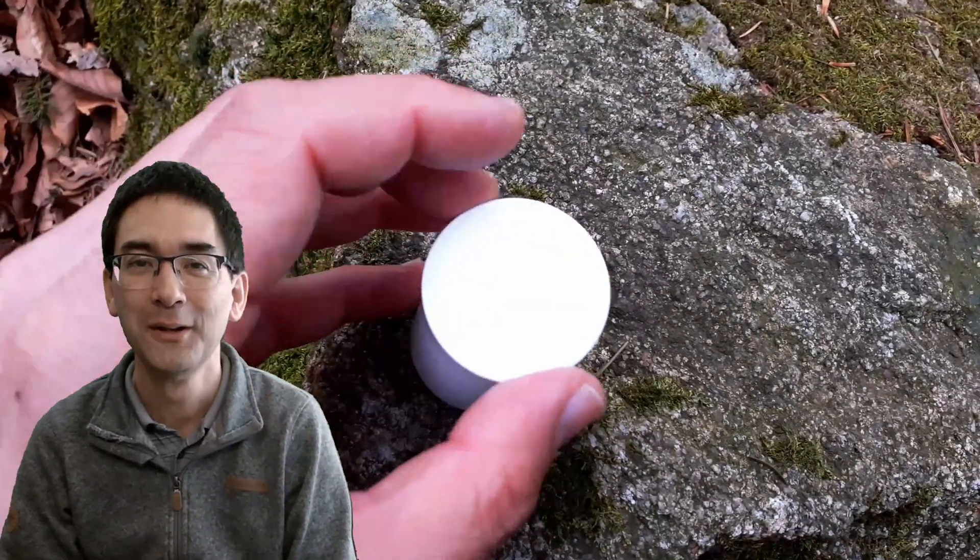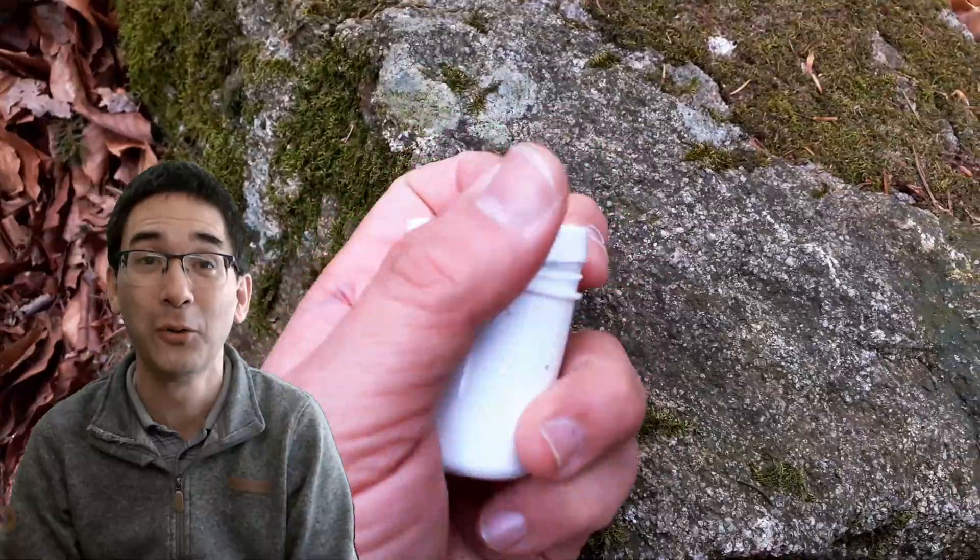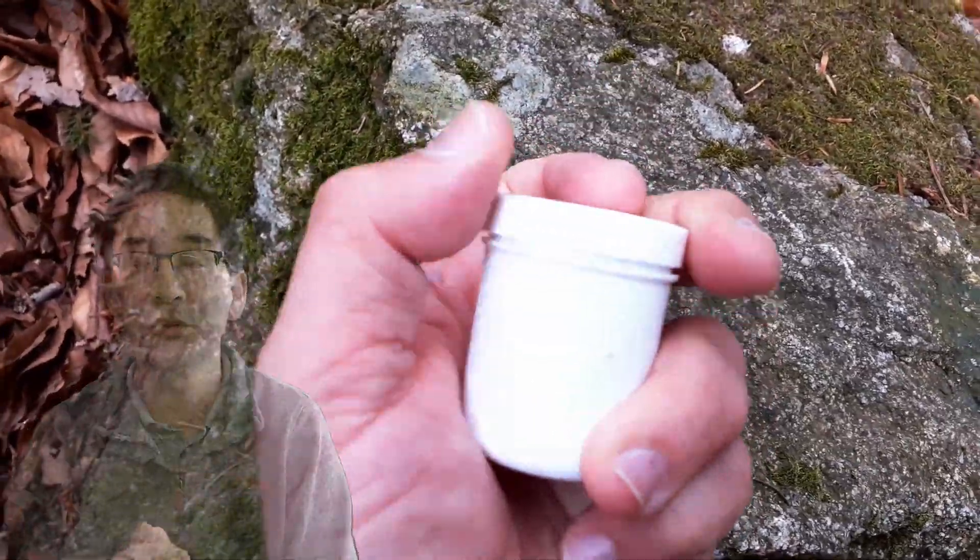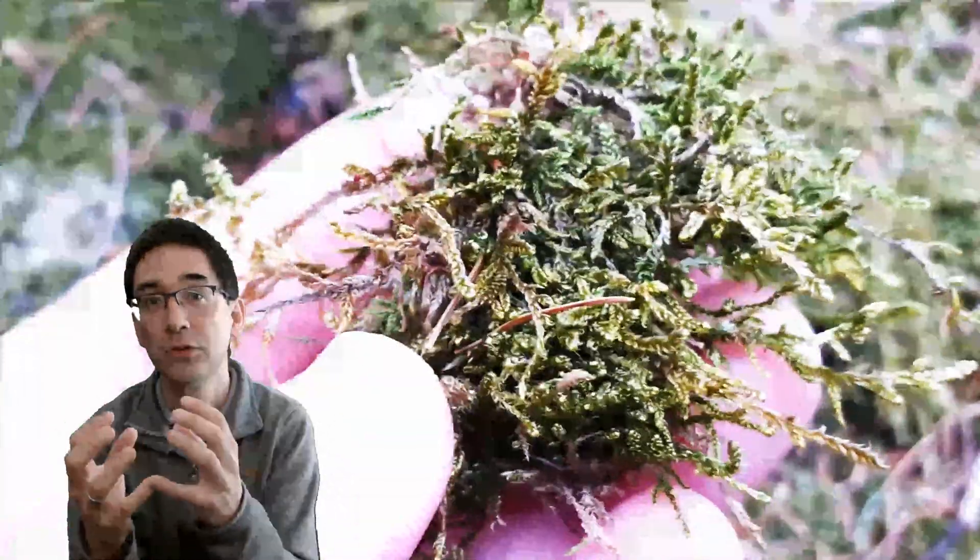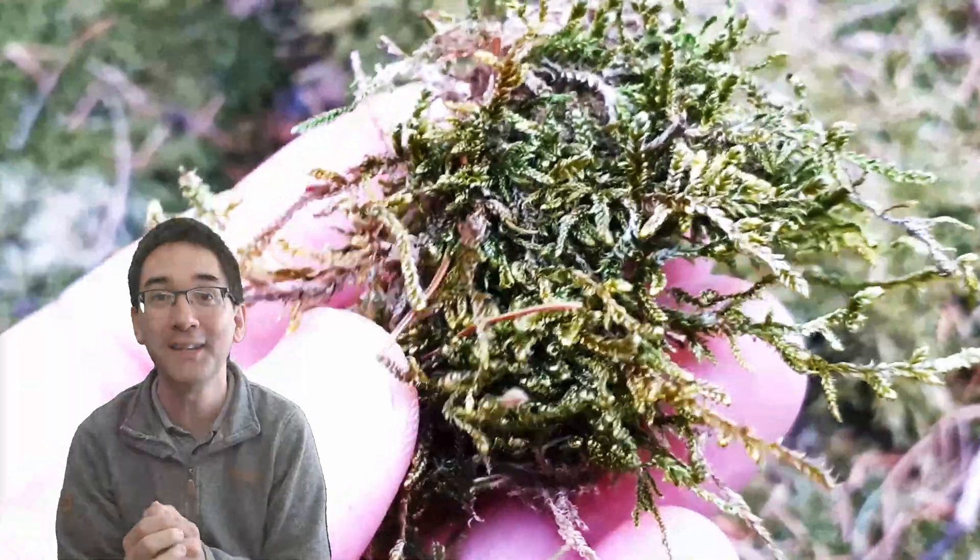I put it into the plastic container and then went back home. And of course at home, and that's really important, you have to kind of reactivate the moss because any tardigrades that are in the moss, they're not moving anymore. They are in this state where they're encapsulated and where they are basically able to survive very long periods of dryness.